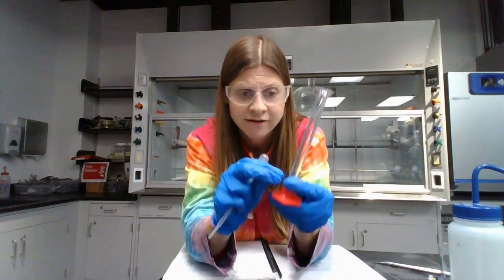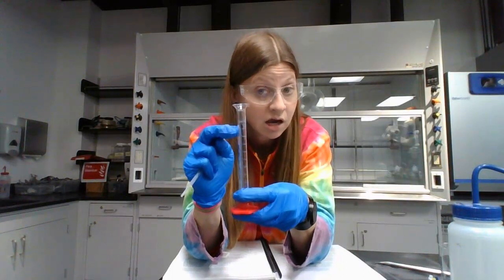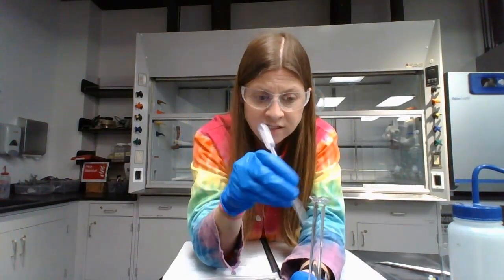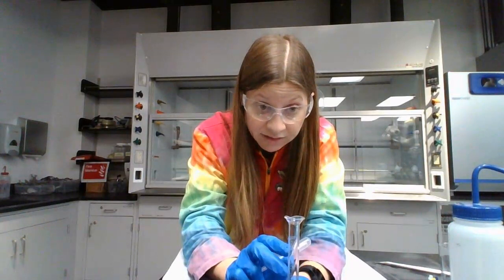Go back to your station and fill the graduated cylinder up to the very, very top line, to the 10 line, with Pedialyte or chicken broth. You can use a disposable pipette to help with that to get it right on the line. That 10 line is the 10.00 line. So I'm telling you your volume has to be 10.00 milliliters of chicken broth or Pedialyte in this. Okay.